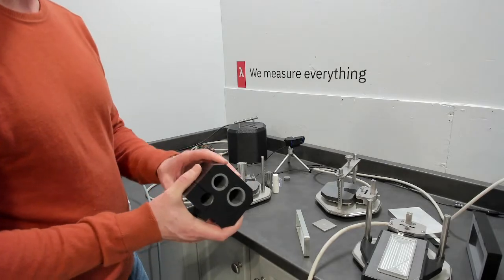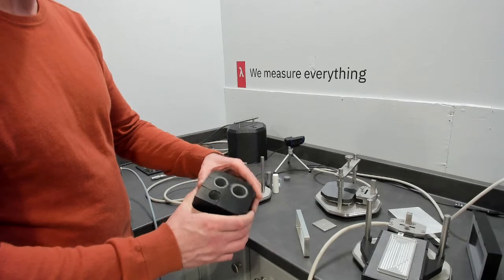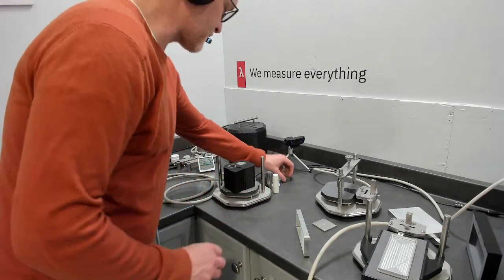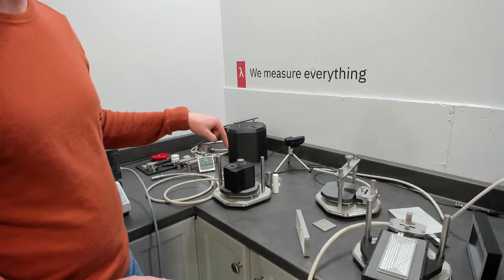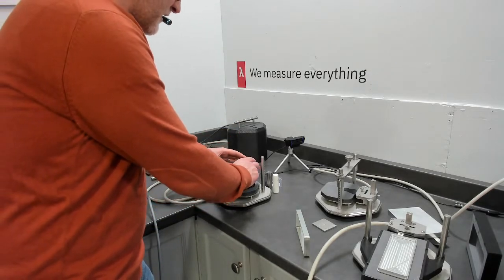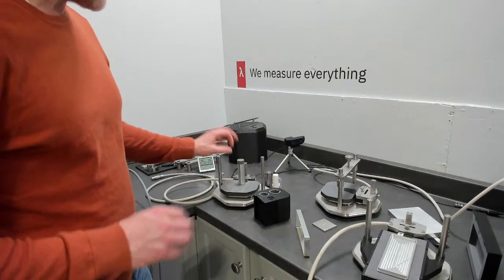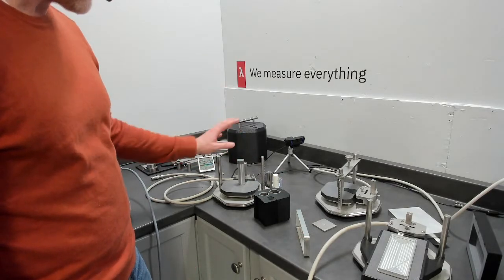batteries, we include one of these, which allows you to insulate the specific heat cell in this shape. They're magnetic, and you place that on top, and then you have an entire insulation for your specific heat measurement. The other holes are for measuring the other configuration. We can make this in different diameters and different heights.